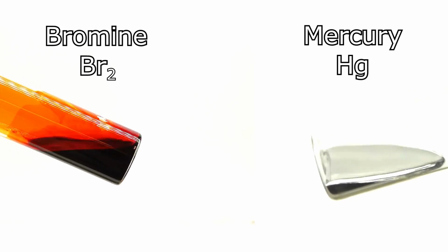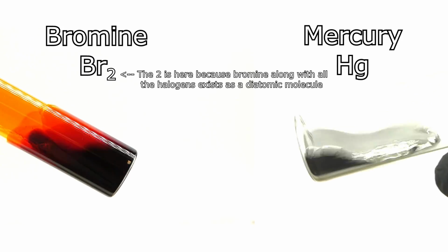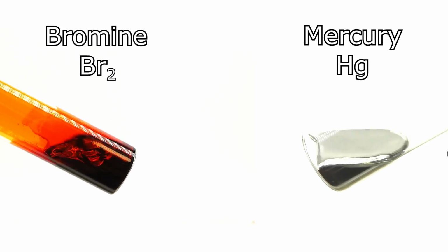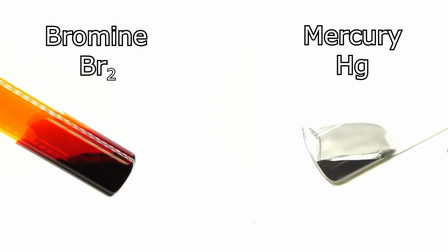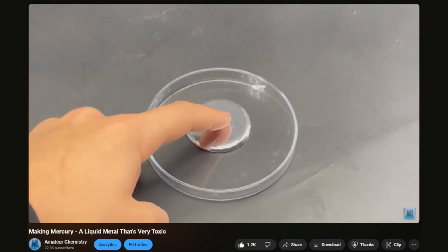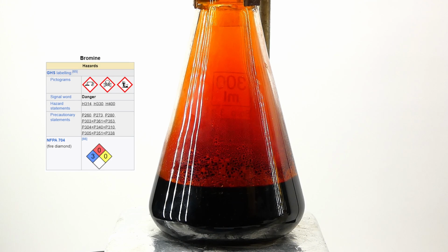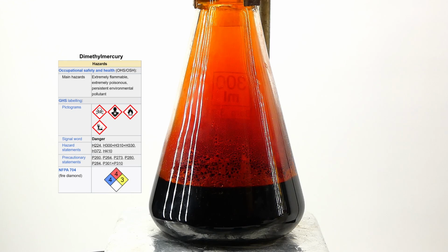Bromine along with mercury are the only chemical elements that are liquid under standard conditions, and that makes them very unique. However, they are rather dangerous, and while mercury is pretty safe by itself, as I showed in a previous video by touching some of it, bromine on the other hand is extremely hazardous in its pure form. However, it isn't as toxic as mercury, because when it's in a compound it's quite safe, unlike mercury, which forms compounds that are toxic as nuts.